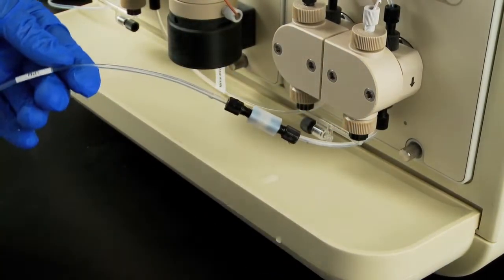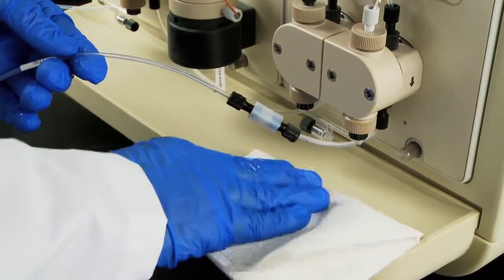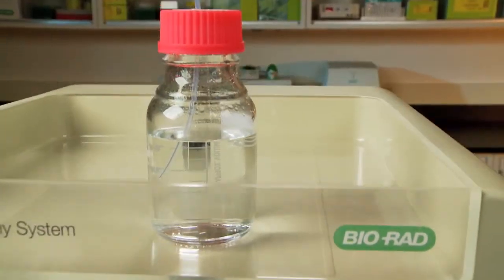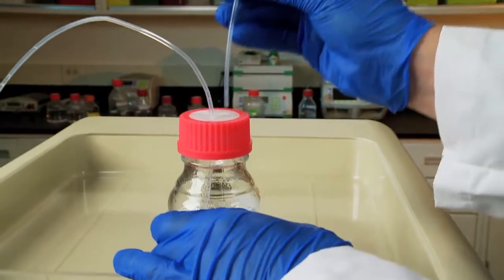Clean up any storage alcohol that may have spilled during priming. Place the end of the outlet line into the pump head wash reservoir.